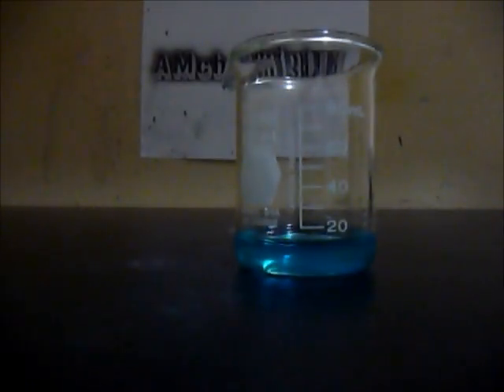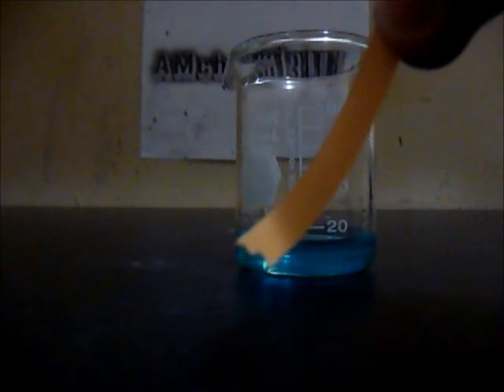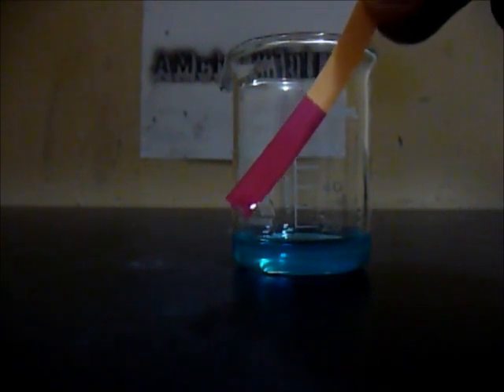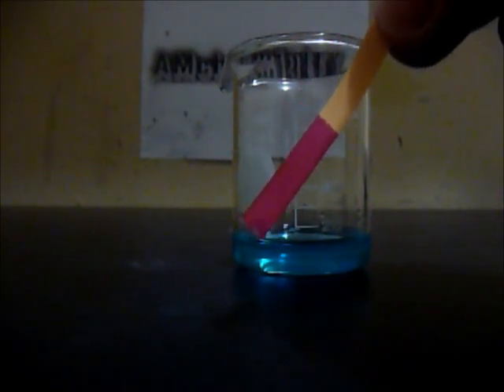But it is still contaminated with sulfuric acid. I will put a pH paper and you see that it indicates that it is red. So that is really acidic. So I would prefer to boil it down, but I don't have a heat plate.